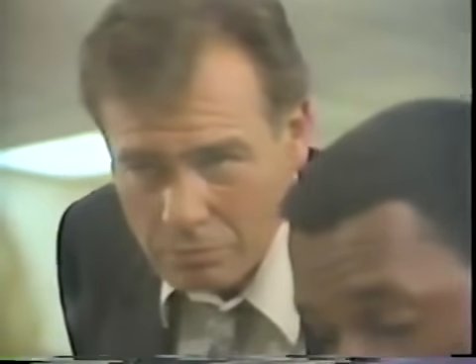This guy seemed to have his acids and bases covered, so I decided to interview a few of his students. What do you want to talk to me for? I didn't do anything. Well, just a few questions here. I understand you were doing some kind of experiment today. That's right. I was making a preparation of hydrogen, which, as you know, calls for mossy zinc and sulfuric acid diluted to a 3-molar solution. Yeah, that's what it calls for, all right. So tell me about it.